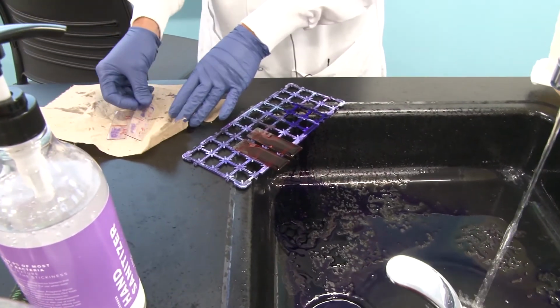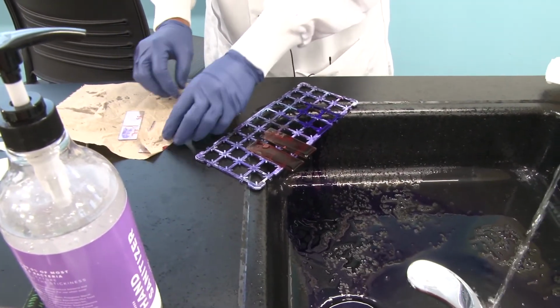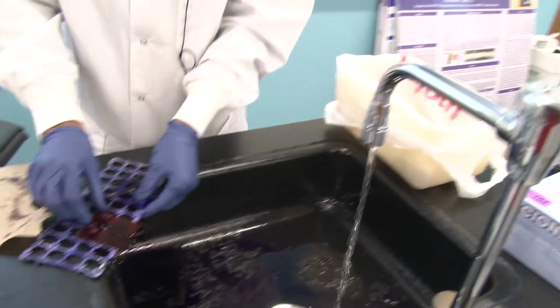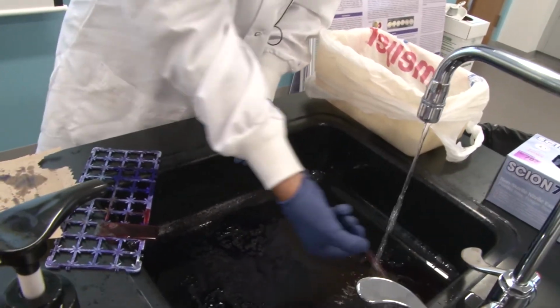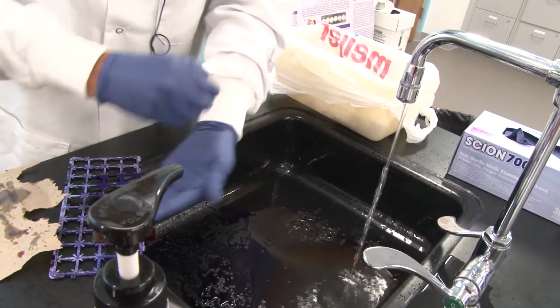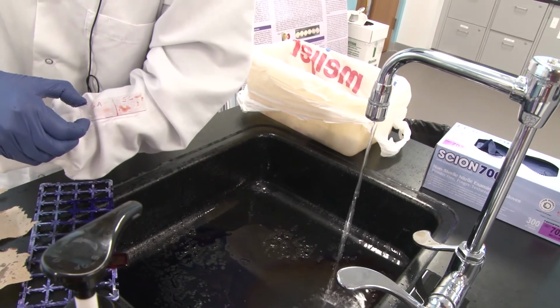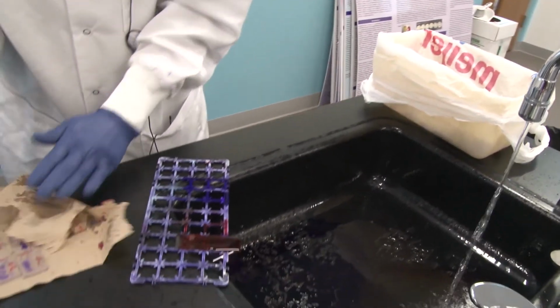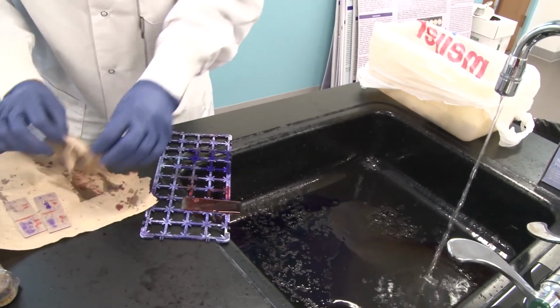because that is going to be a problem if you put it upside down on the microscope. And here are the safranin slides. Let's take a look at those. I think you can see that the safranin stained those smears pink. Okay? Wipe that and tap it dry.